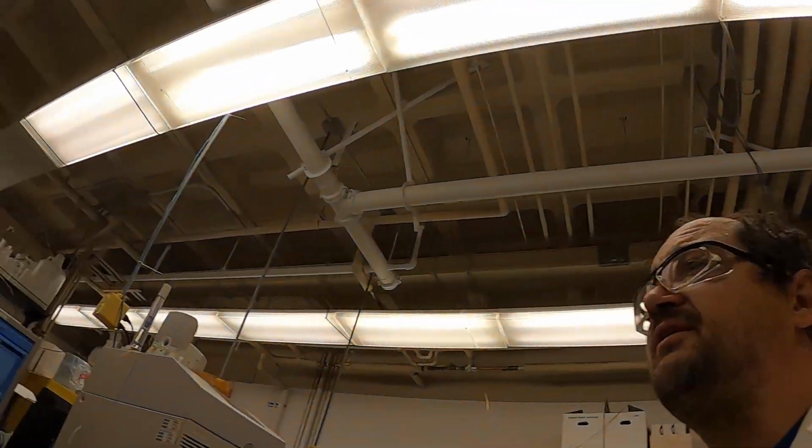I'm Paul Harvington, and this is your capillary electrophoresis training video for CHE-115.